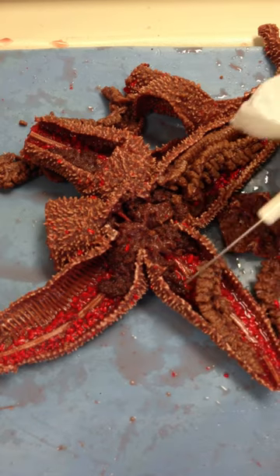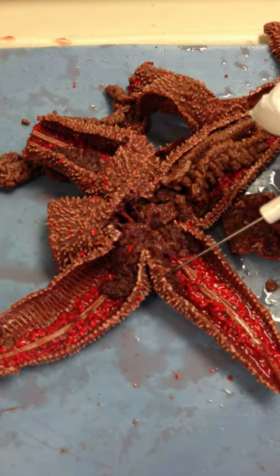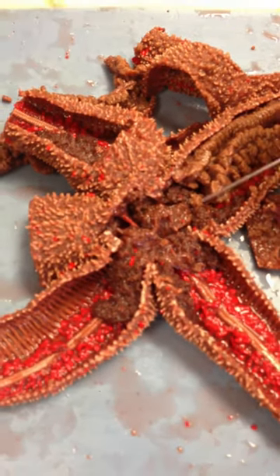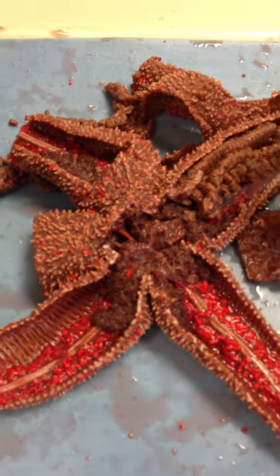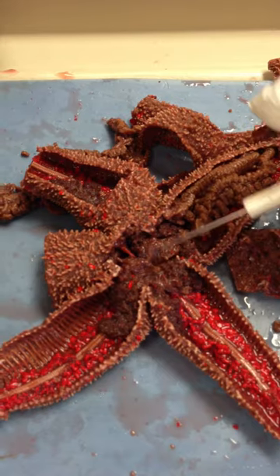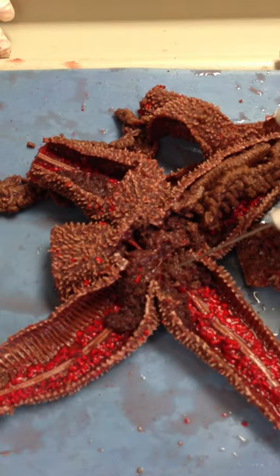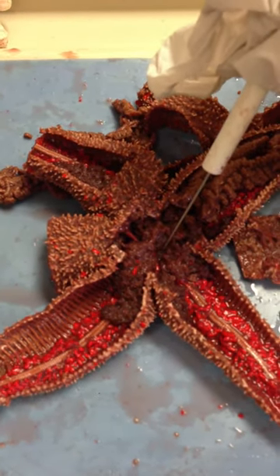If we were to pull back some of our digestive cecum, what we're going to see is this darker structure, and if you notice in each one of the arms, it is a consistent color. The gonads and the digestive cecum will run down here. So these are the gonads, and this is the digestive cecum. We have the pyloric stomach on top, and underneath the pyloric stomach, we actually have the cardiac stomach, which is going to be further in this area right here.